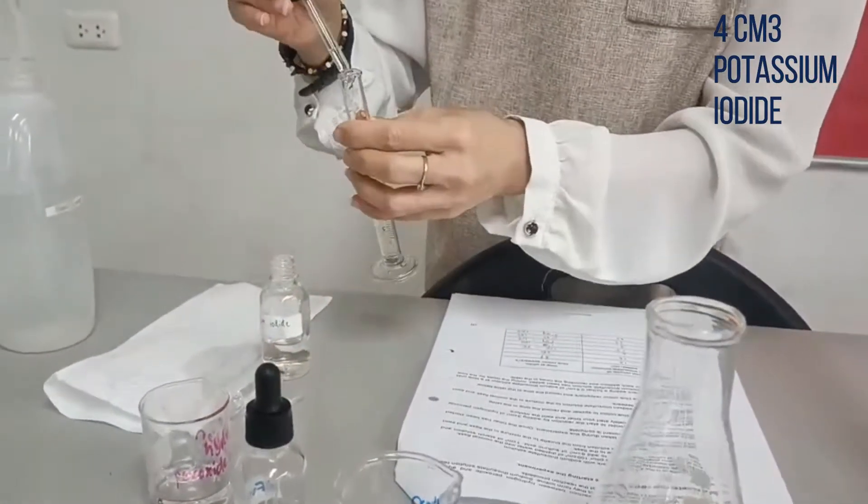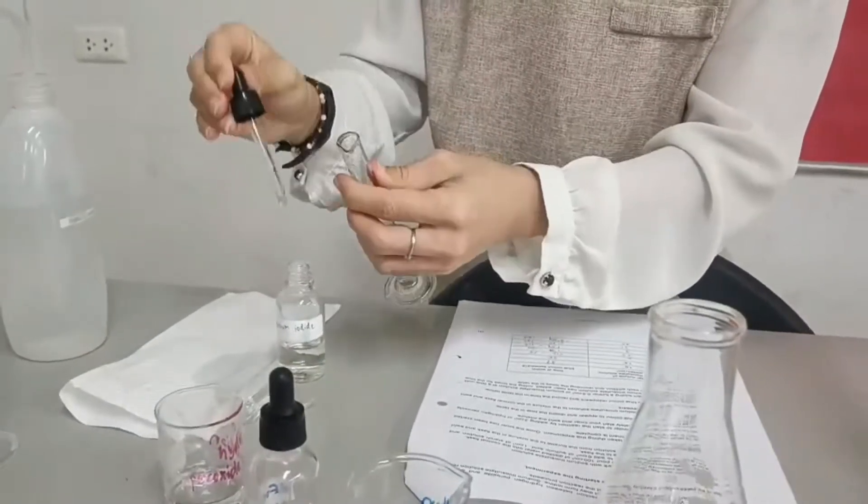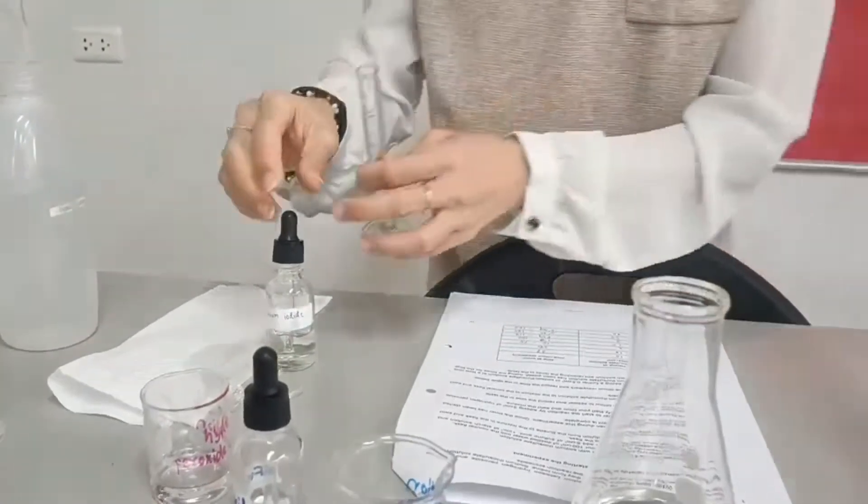I just wash the measuring cylinder, but it doesn't matter if you don't wash, but I need to rinse this now with potassium iodide.